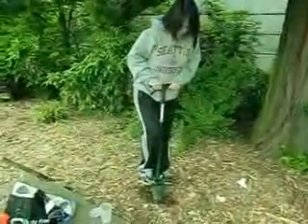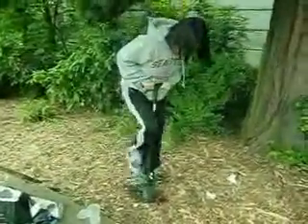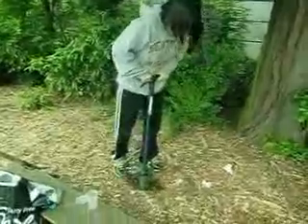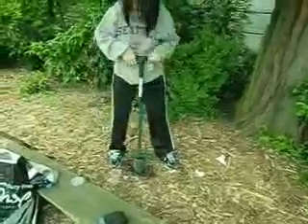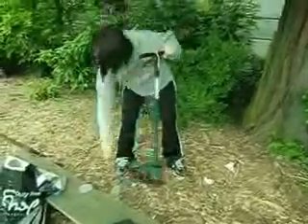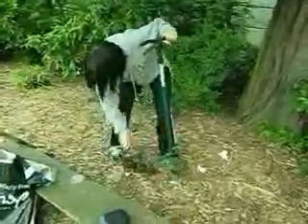So now Debbie is attempting to take a soil sample of the top of the ground. See, she's just kicking it in. We only need maybe about 20 grams, so whatever amount of soil she can get would be fine. And now she will empty the soil into our sample container, which she just knocked down.